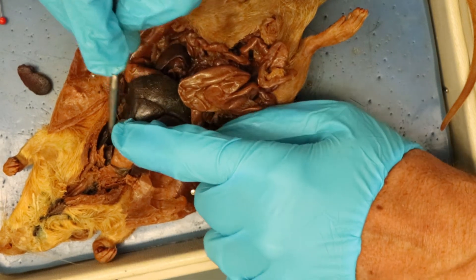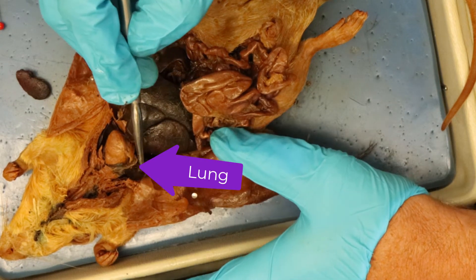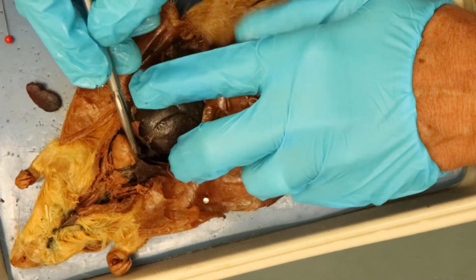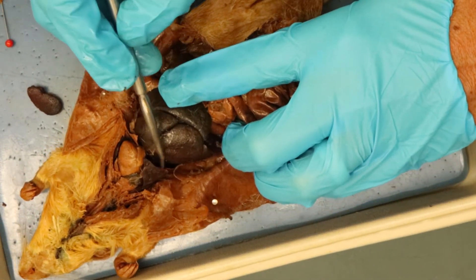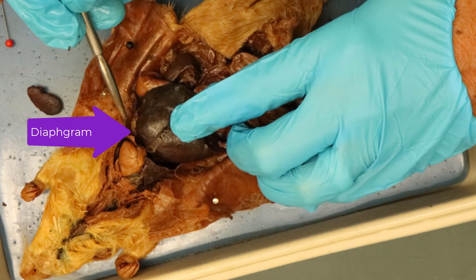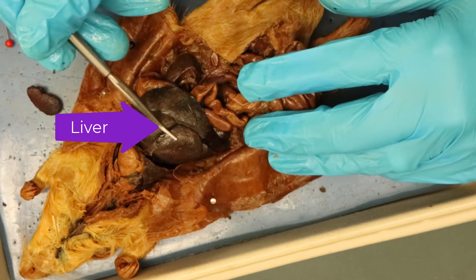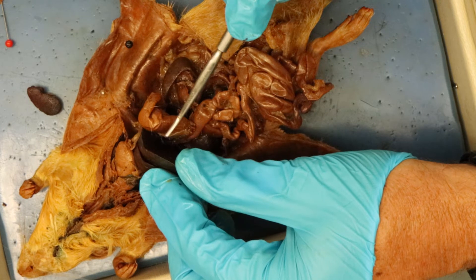Next to the heart we have the lungs — you can see the lungs right here on the side. Right below the lungs we have this very thin structure, sitting between the lungs and the liver. That thin muscle right here is the diaphragm.